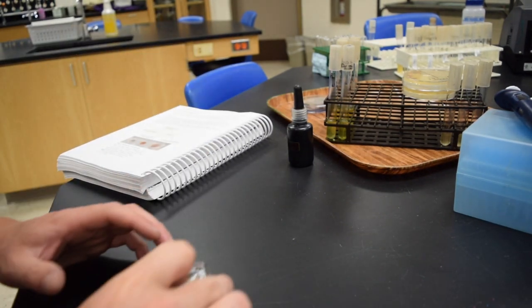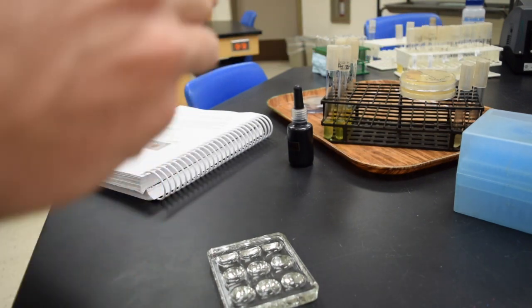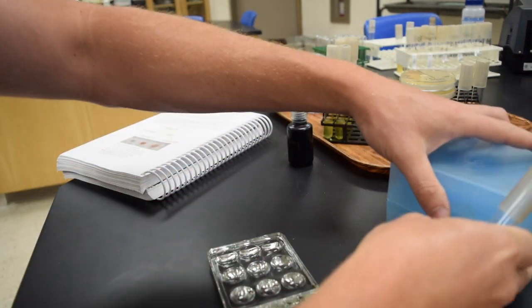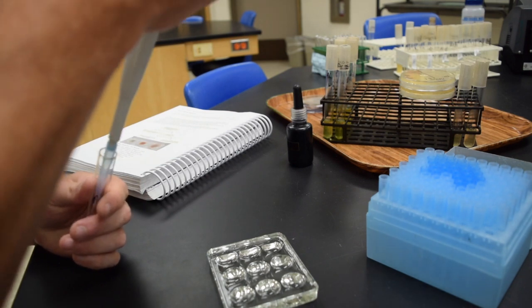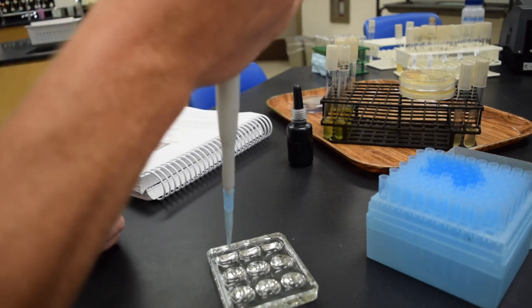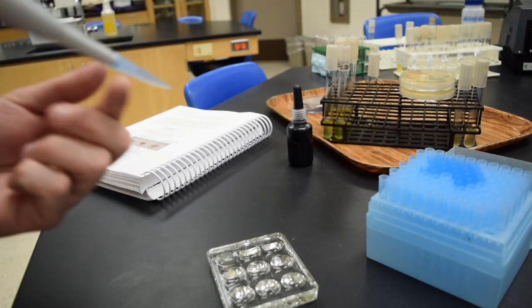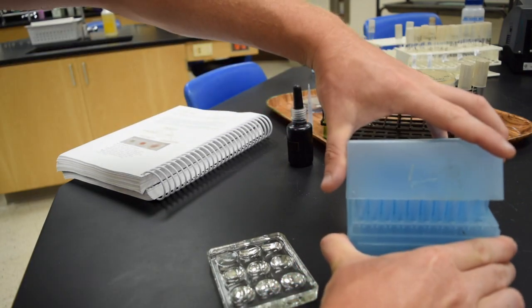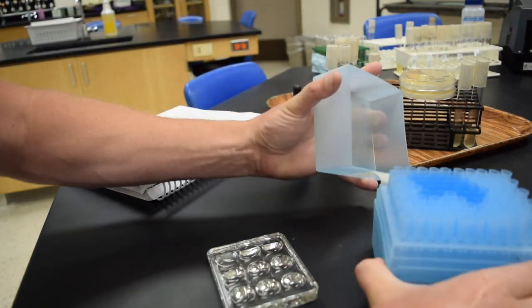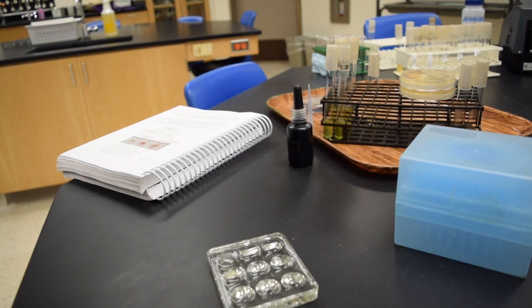The next part is the nitrate reduction test. Here I have a spot plate, and I'm going to start with Alcaligenes, and I'm going to pipette 1 ml into the spot plate. So Alcaligenes on the left, keep that in mind. This nitrate reduction media is testing the bacteria's ability to use nitrate as an electron acceptor in an anaerobic respiration process. So following along with the little flow chart there, I have Alcaligenes there.